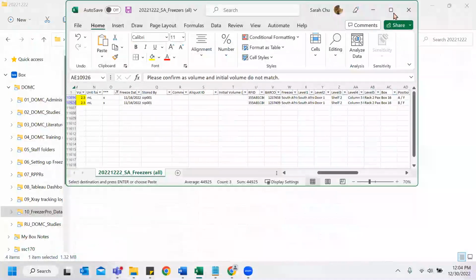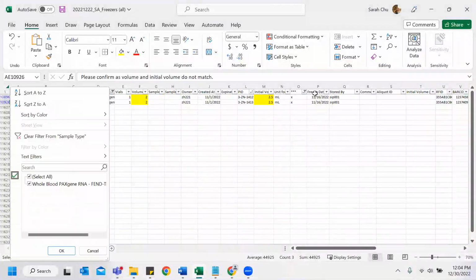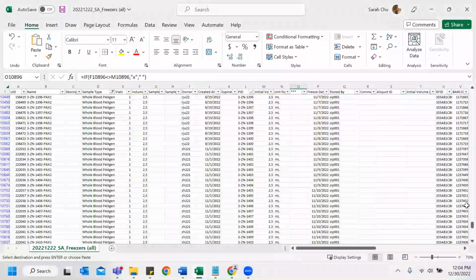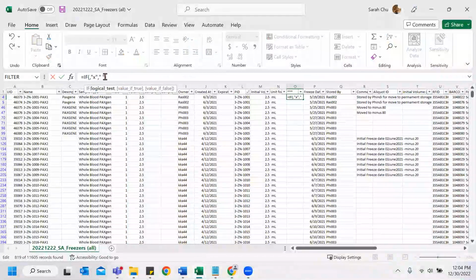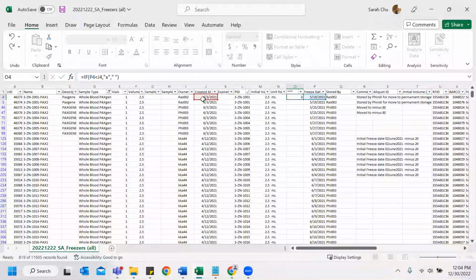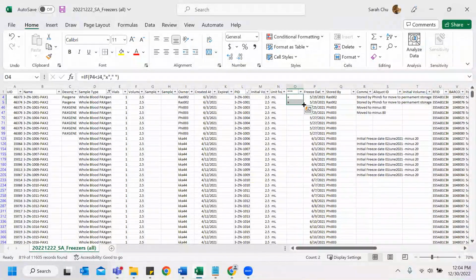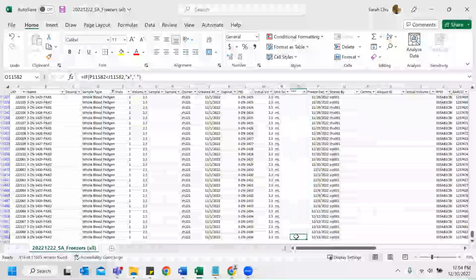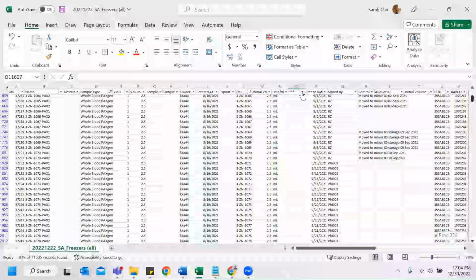Sorry. And then be sure to check here and the date. Freeze date is less. I'm not sure why. Okay, so it's inputted properly. And then go up and do the same thing, filter for X's.